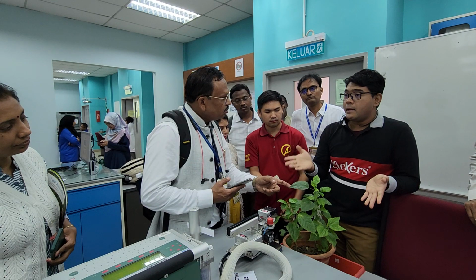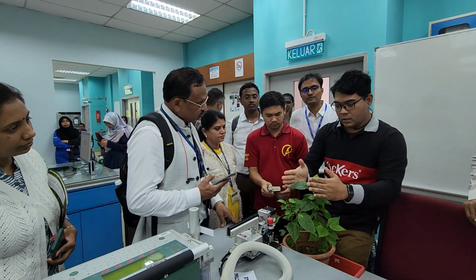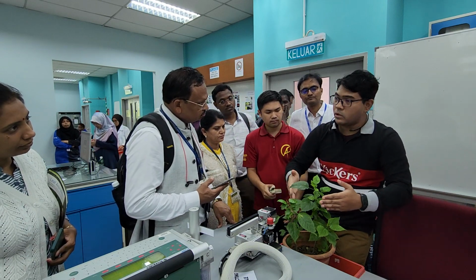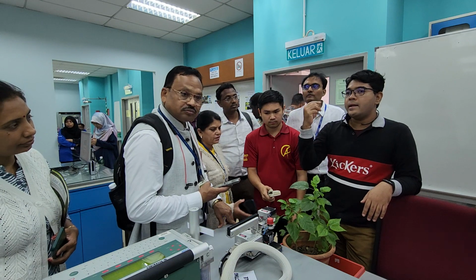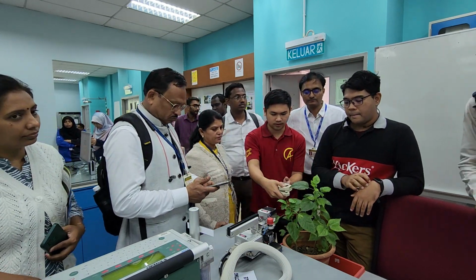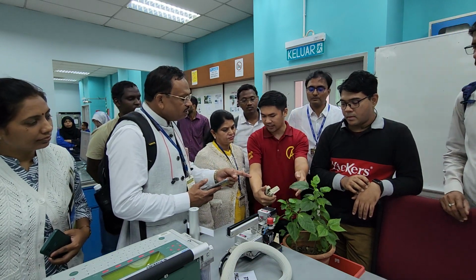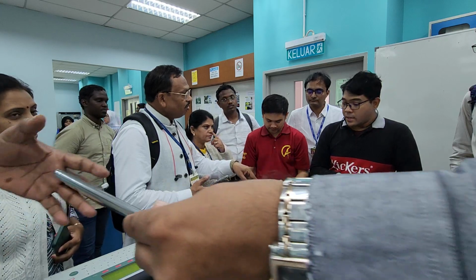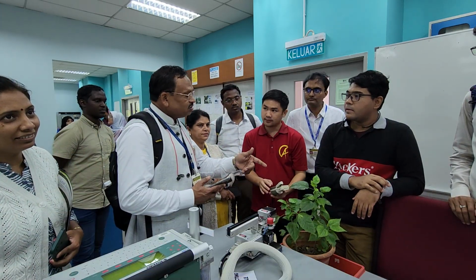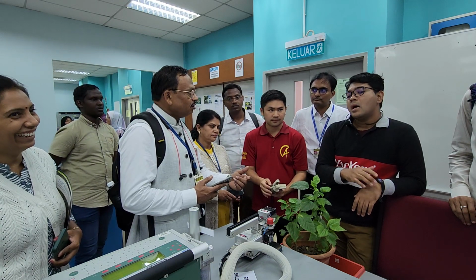Some people are studying sun leaf and shade leaf, so they take from the outermost and then go inwards. Average. So you get the idea. Randomly we have to select. You can see it is darker. You can take the mean. Leaves of different shape and size will be selected and then you take the mean.